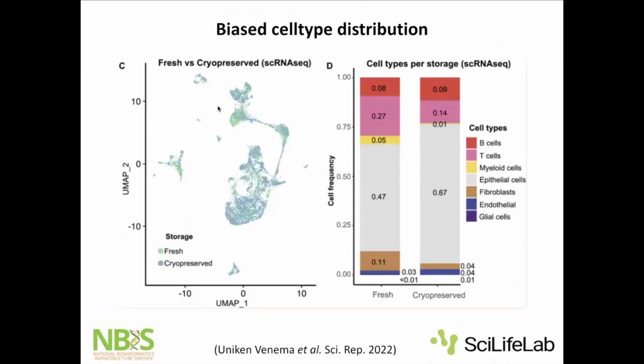I should add a slide with that. Yes, and then, as I said, we might have a biased cell type distribution. In this case, it's actually just comparing fresh versus cryopreserved. Then we can see that some cell types survive the freeze and thaw cycle much better than other cell types that become more or less depleted after freezing. But that's exactly the same with different dissociation protocols also, that you might get a biased cell type selection depending on what dissociation protocol you're using.